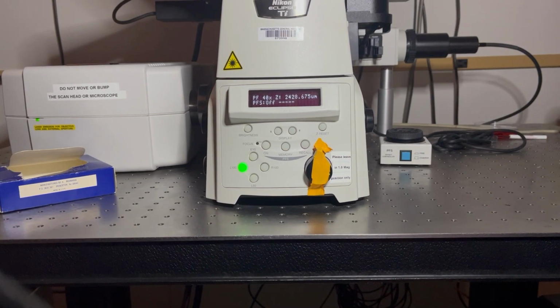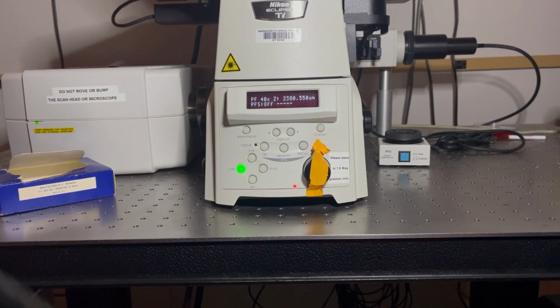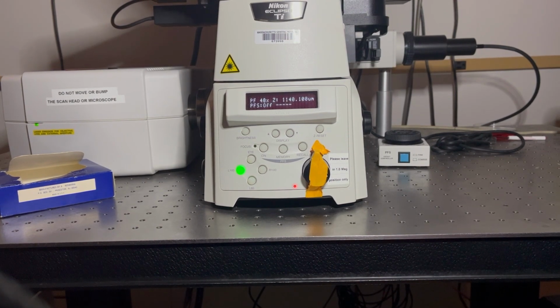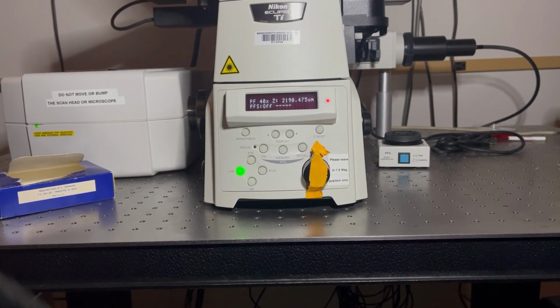So now I'm going to go on to some microscope features. These are more of the buttons that are on the scope that you can use. When you first come in, you will see that there's this front panel, and this tells you a couple of things about your sample. It first tells you which objective you're using, and it also tells you the Z position. When you first turn on the microscope, the default Z position is around 500 micrometers.